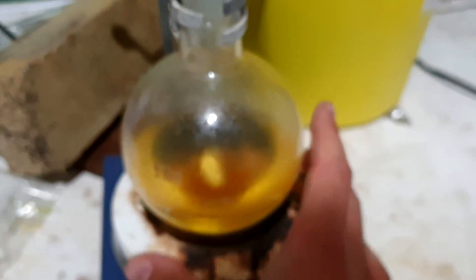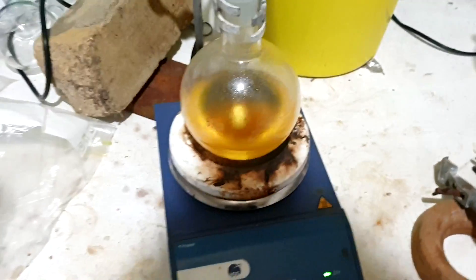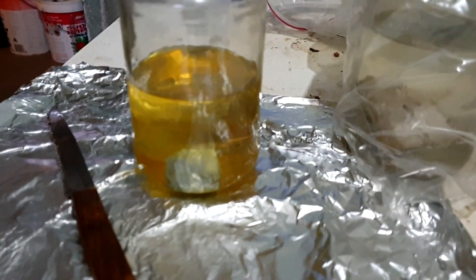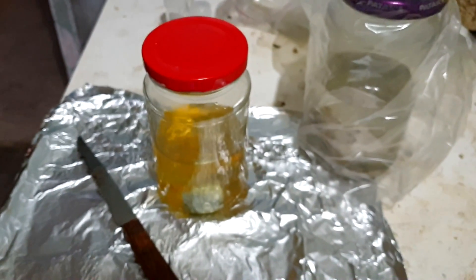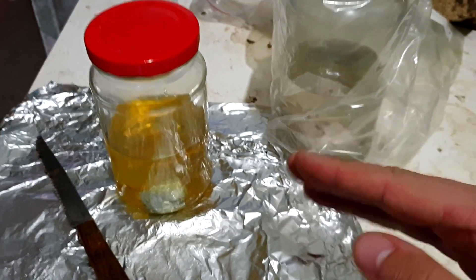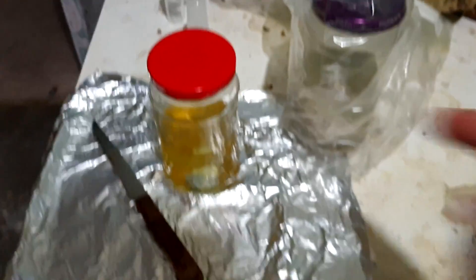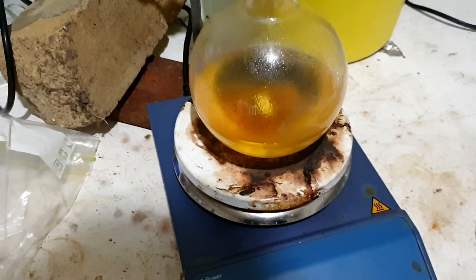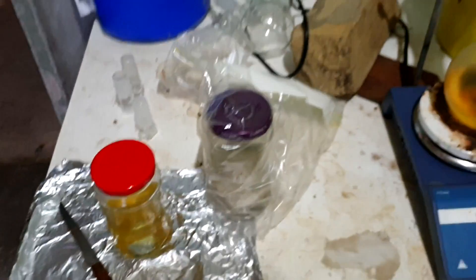It's reacting pretty slowly now. I did actually heat the solution up quite a bit because that last little batch of potassium — this is the third batch — was reacting really quite slowly. I've heated it up and it's still taking its time, so I really don't think there's too much water left. Good news is our potassium is all clean. I'm going to leave it in that yellow mineral oil because I don't think that poses any danger at this point. We're going to set it up for simple distillation now. I'll put all the flammable metals away first.